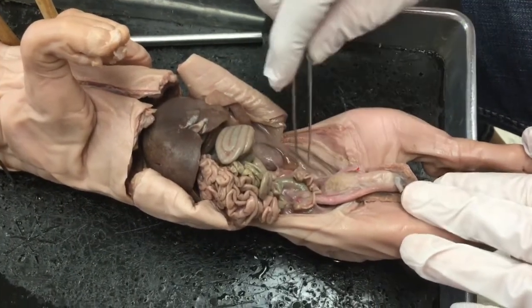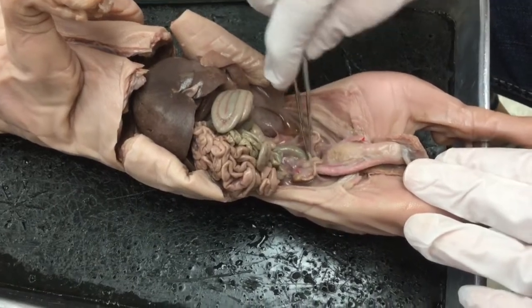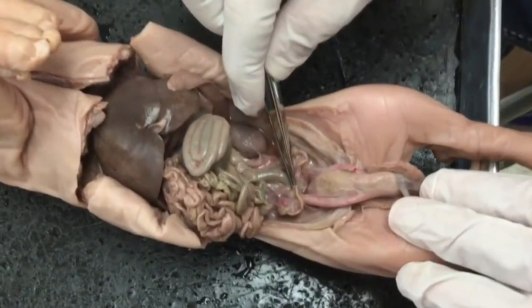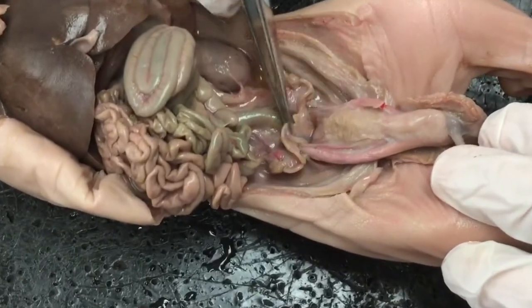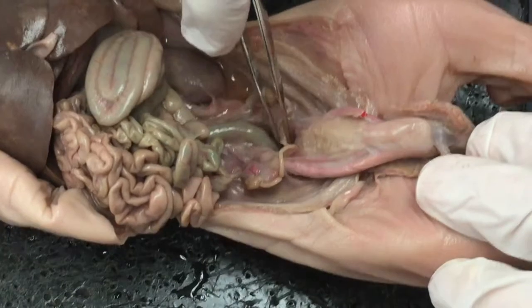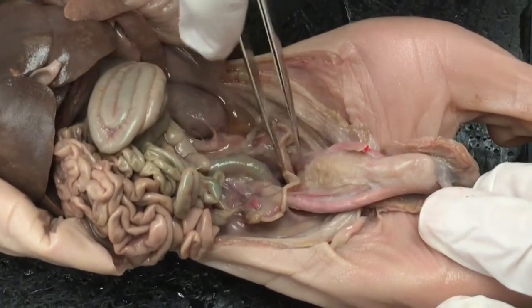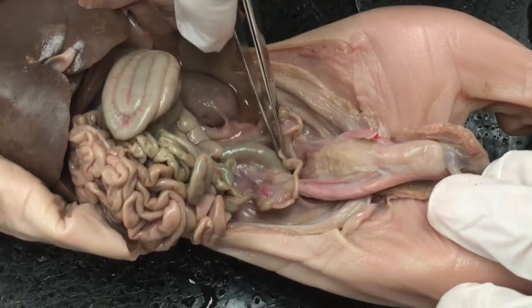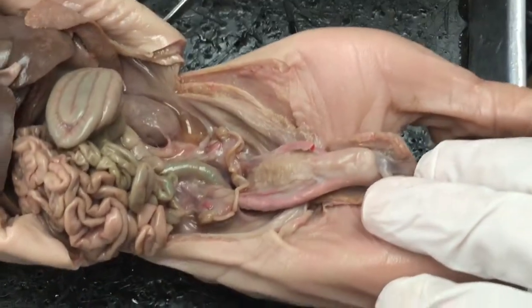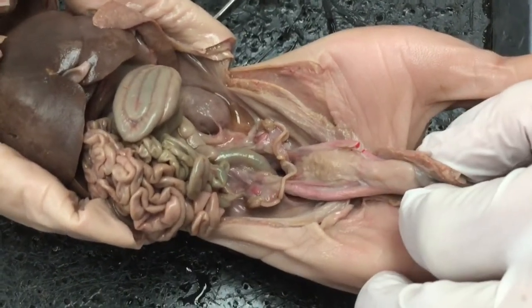the uterus. So once I have this open, I can just take my tweezers and lift up, and down there is the uterus. So let's see if we can kind of zoom in there. That bag structure that we see where the two fallopian tubes meet, that's my uterus. And the uterus has the ability to expand. So you can see when it expands, it puts pressure on the bladder, which causes a lot of women to feel like they've got to urinate all the time when they're pregnant.